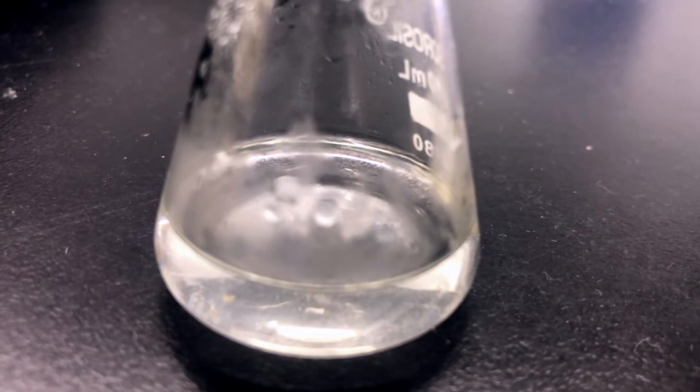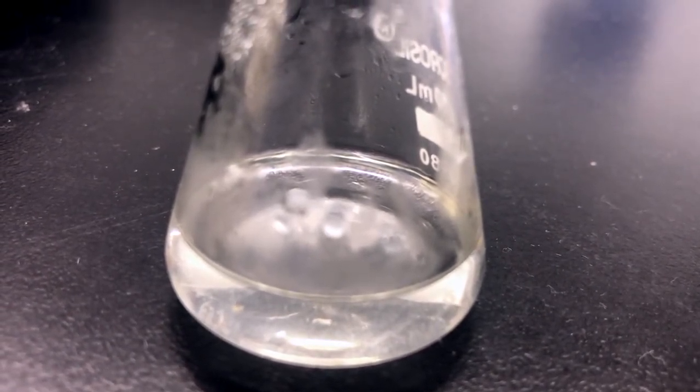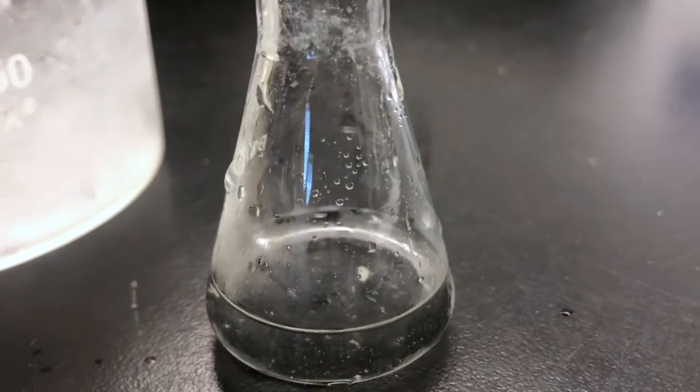So once we're satisfied that we've achieved that ideal state at the end of the heating period, we can take our flask off the heating source and let it cool to room temperature on its own, and hopefully crystals would form. But of course, in this case, we were fated not to have any crystals form. Every once in a while, you could see a little tiny piece of crystal here and there, but the crystals just would not form as it cooled down.